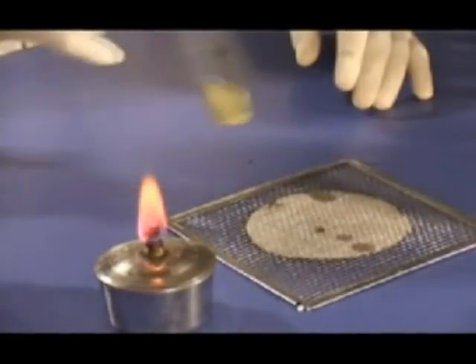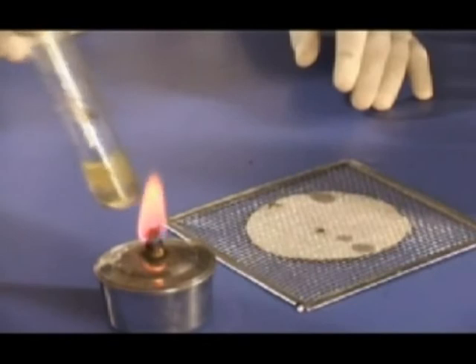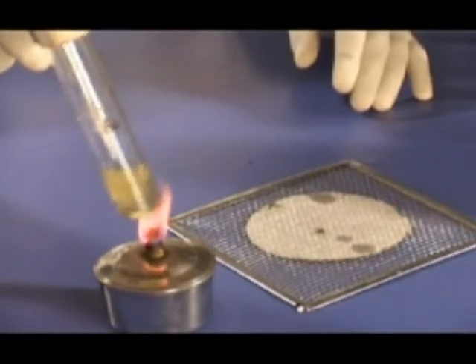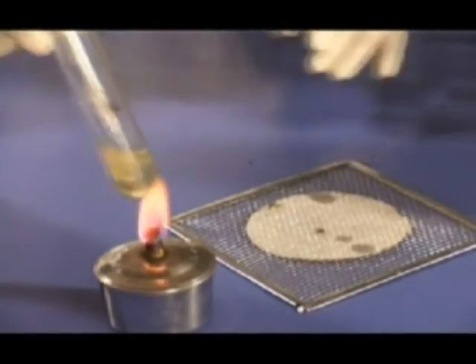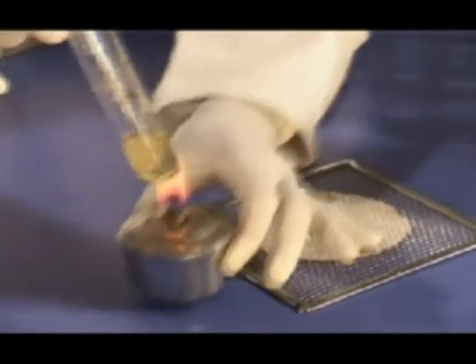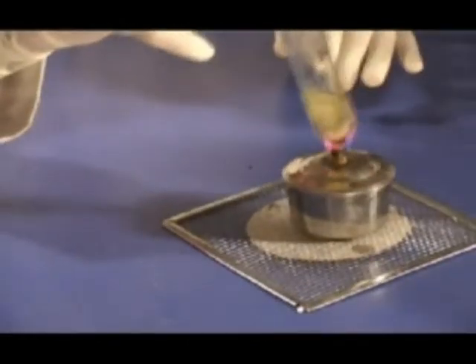Step 5: Boil the sample in chlorophenol. If soluble, it is polyester fiber. If insoluble, go to Step 6.